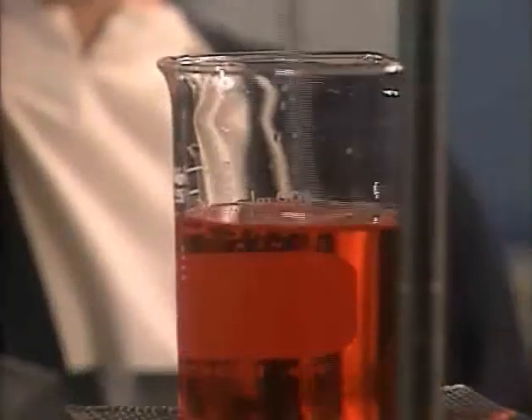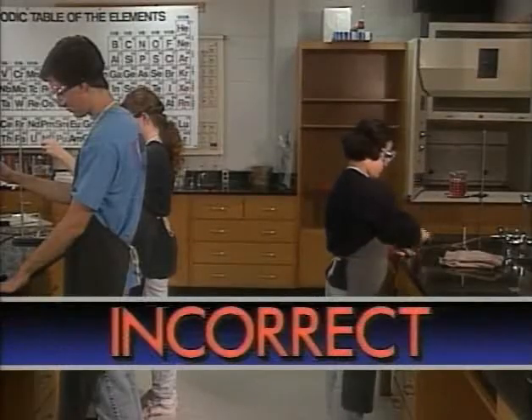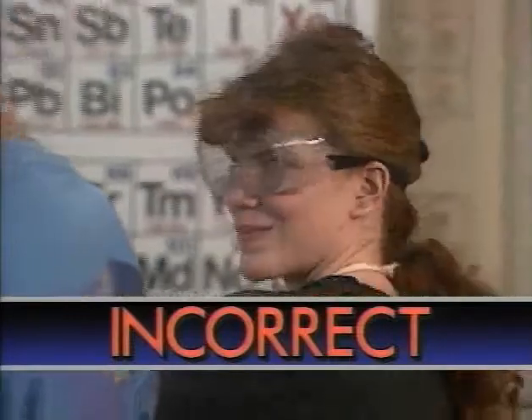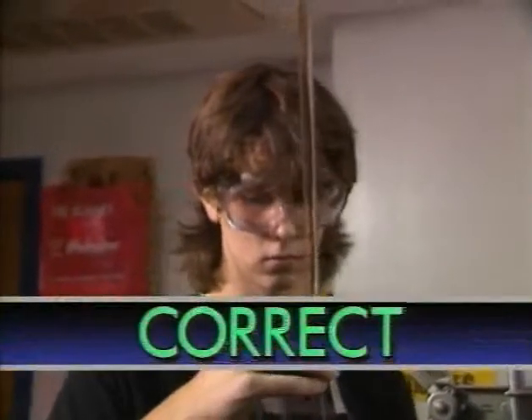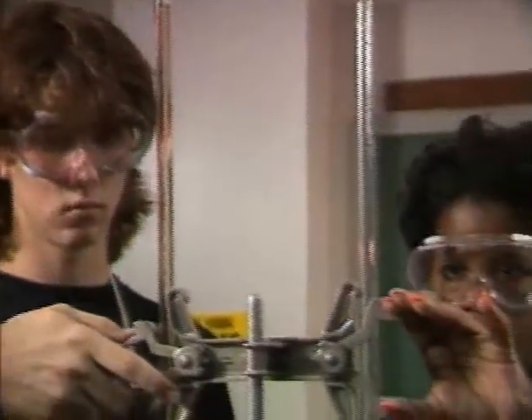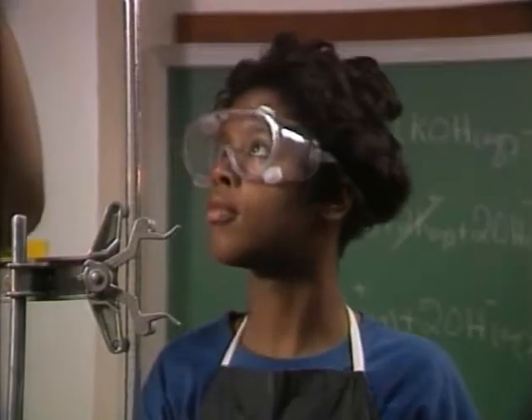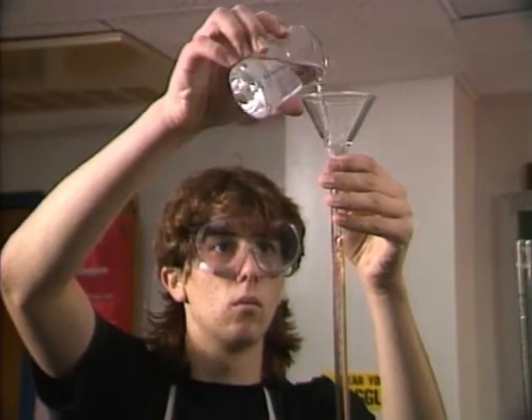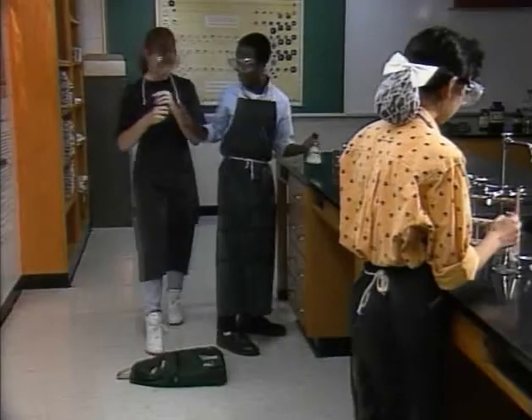A chemistry laboratory is full of beakers and bottles holding chemicals — fooling around can have disastrous consequences; you could scar yourself or others for life, or even cause blindness. The most important rule in the lab is no fooling around: don't run, push, wrestle, or even move fast. Even if you're not fooling around, accidents can still happen.